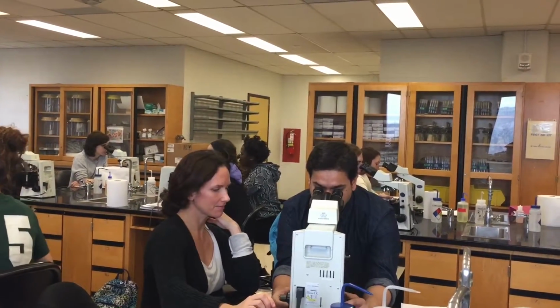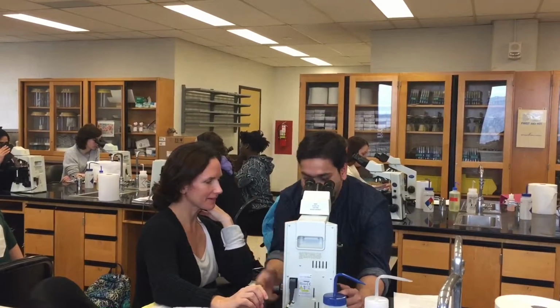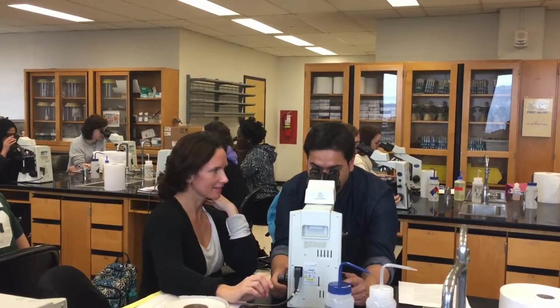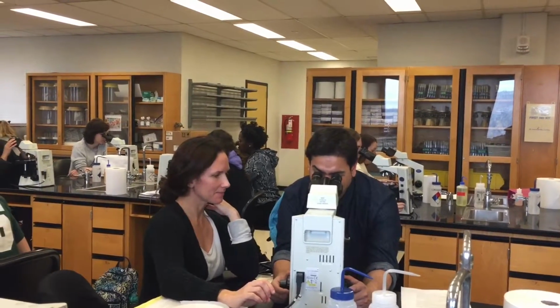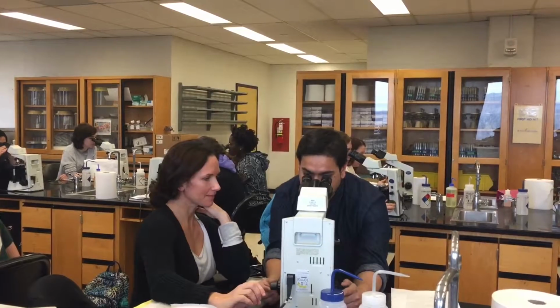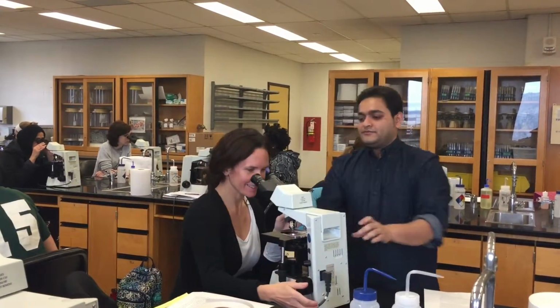So what you do is kind of keep your eyes like this. I'll keep on rotating it so that this guy goes down. Okay. So I keep my eyes there. When I was going down, I missed it in between, so now I am slowly coming up. Once I find it, I'll go in the center. Have a look.